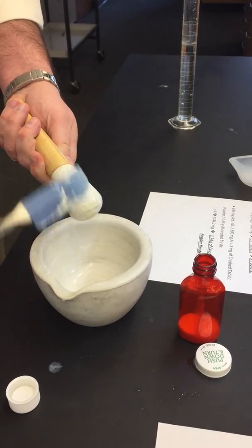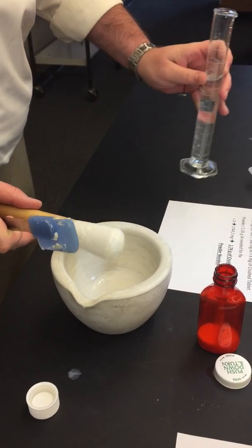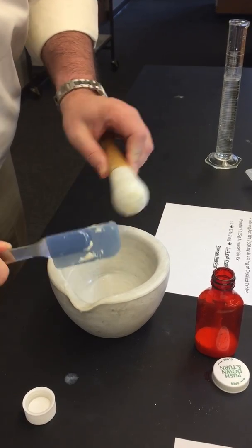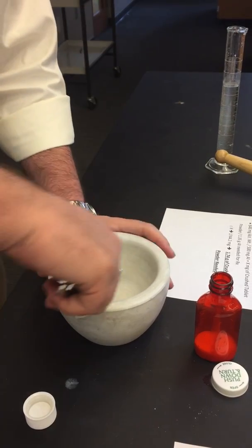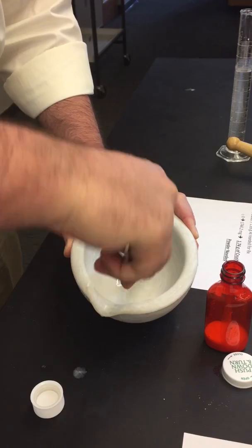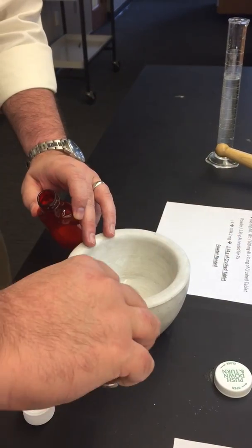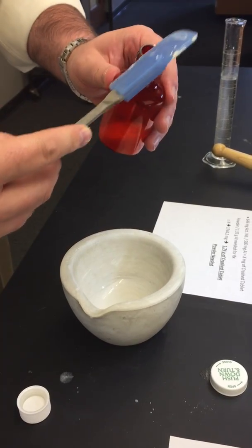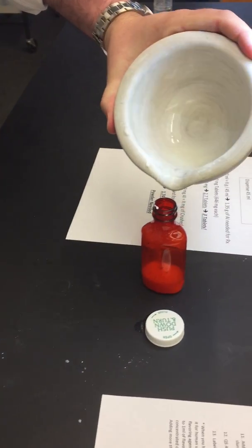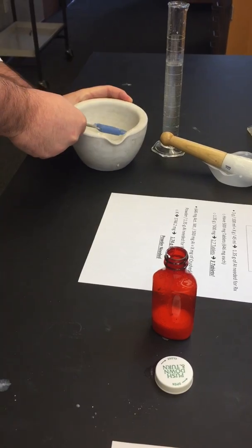With our spatula, we can do another wash. Put this guy away. Try to get as much as you can off of your latex spatula. You can also use the side of this, try to reincorporate it, put it into your amber vial, transfer your last little amount. You could wash it again if you wanted to.